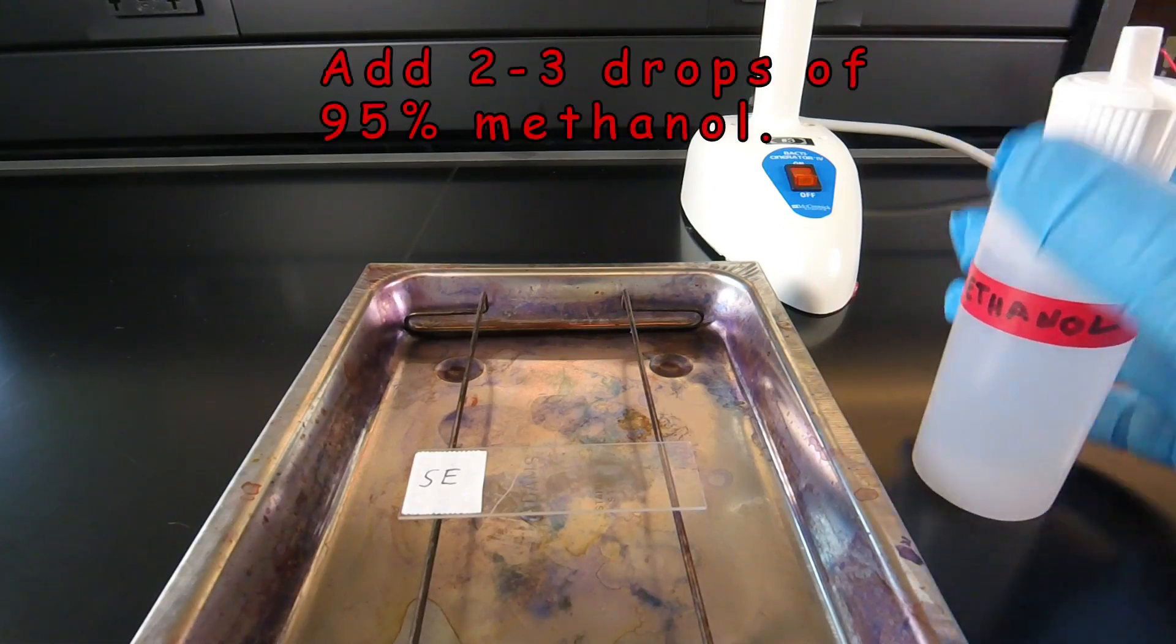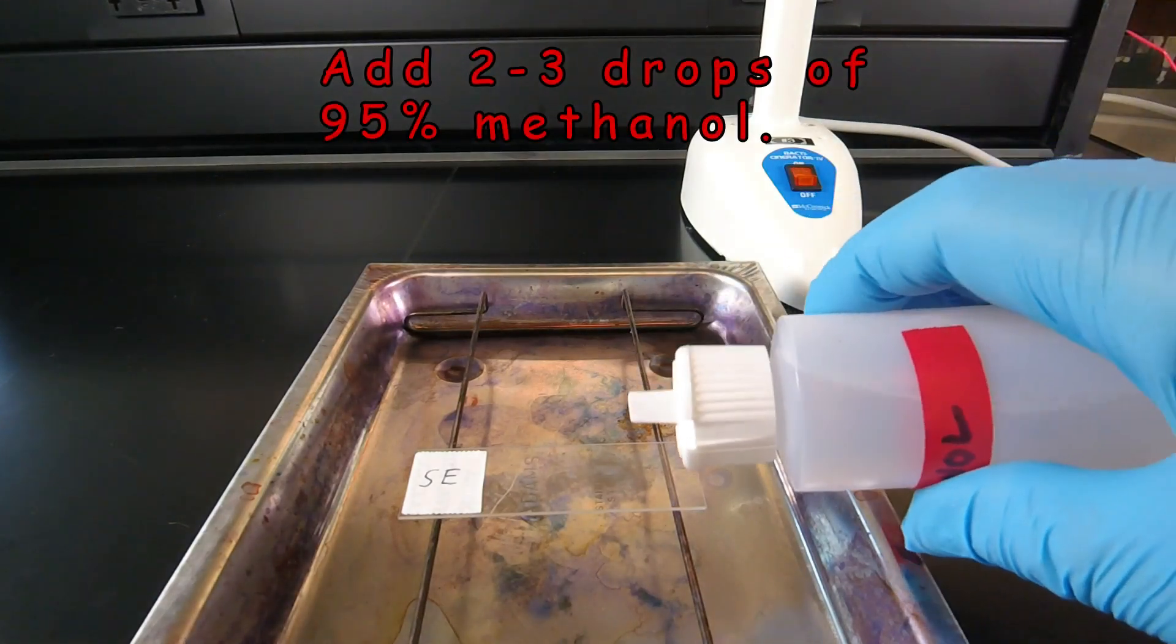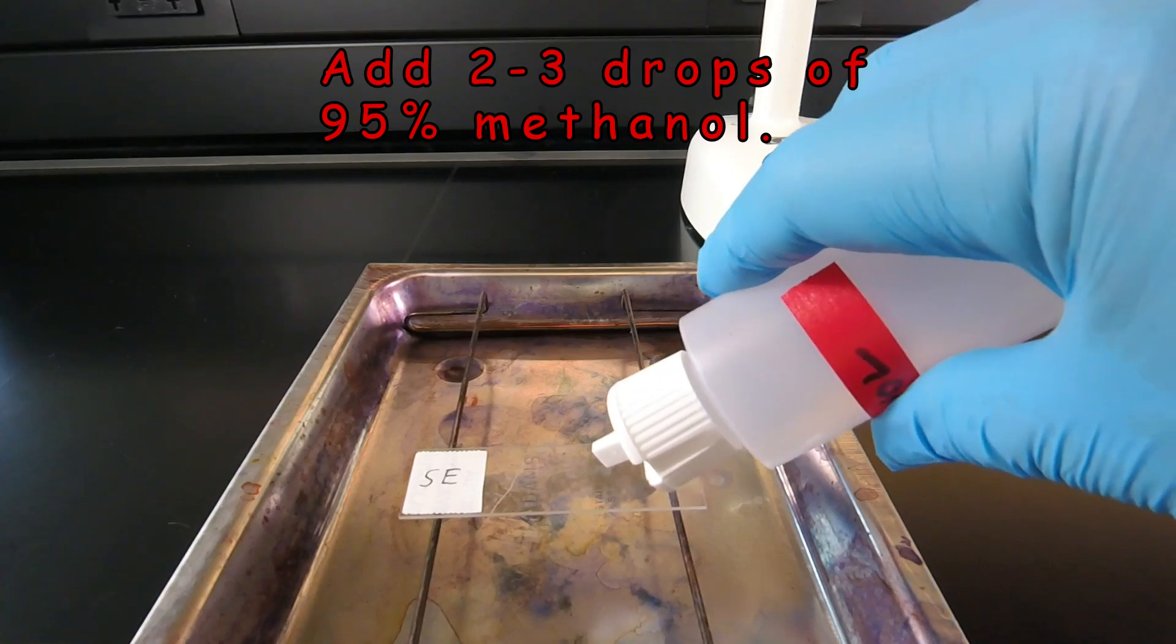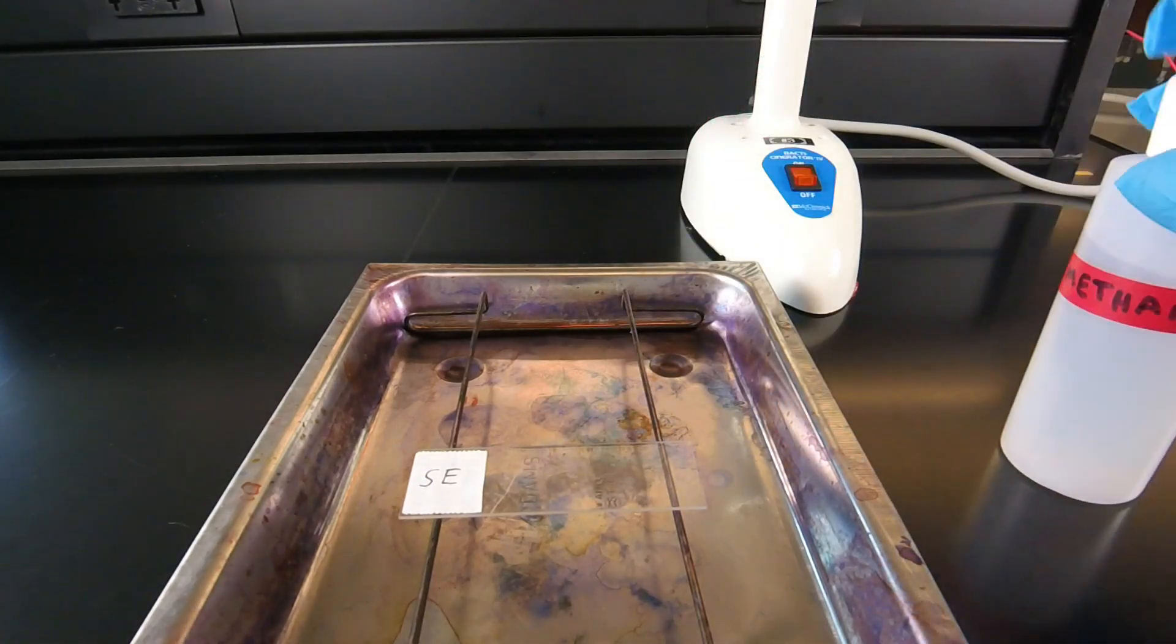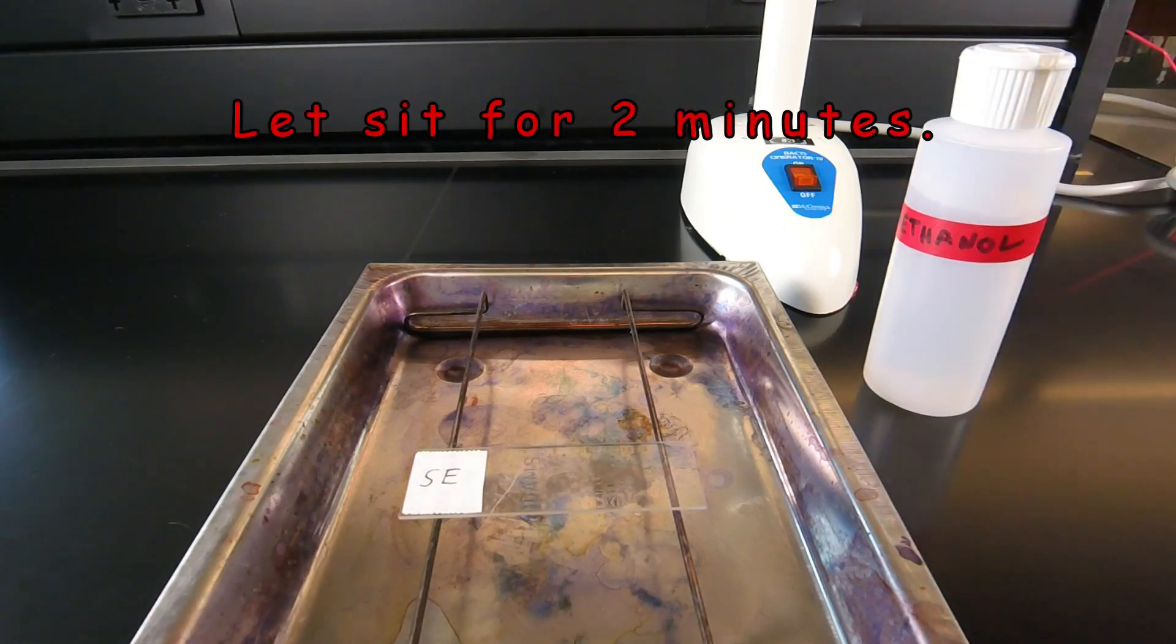Then we're going to take a few drops of methanol and drop that over the smear. We're then going to let that sit for two minutes.